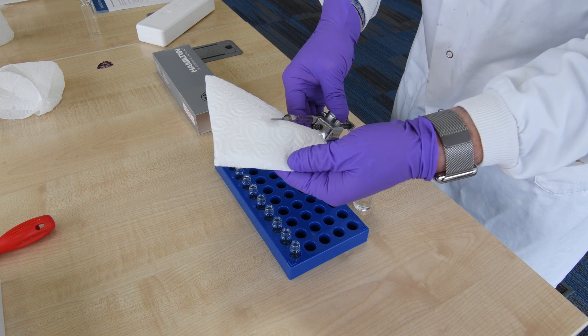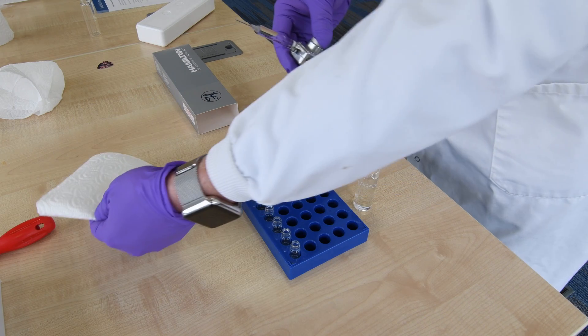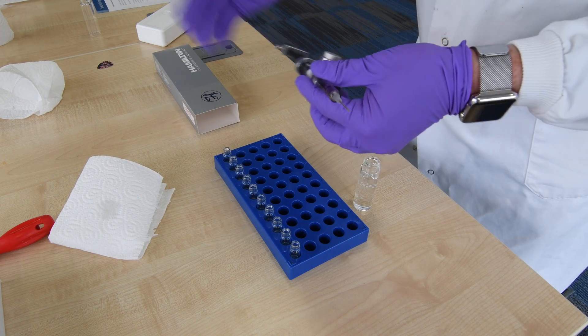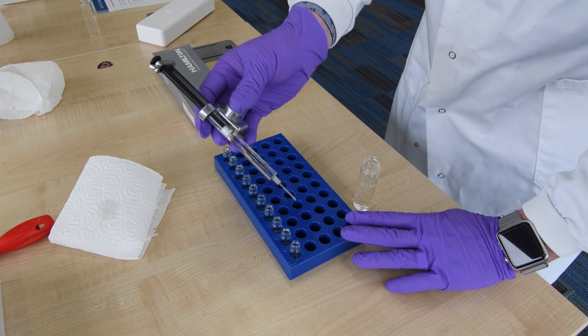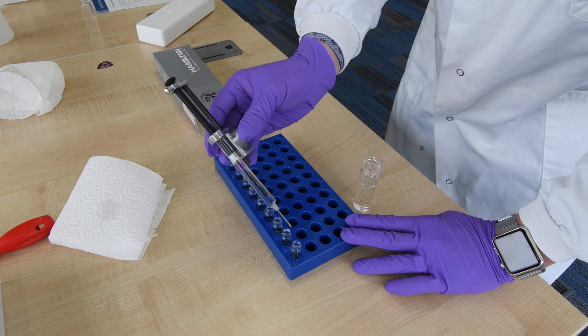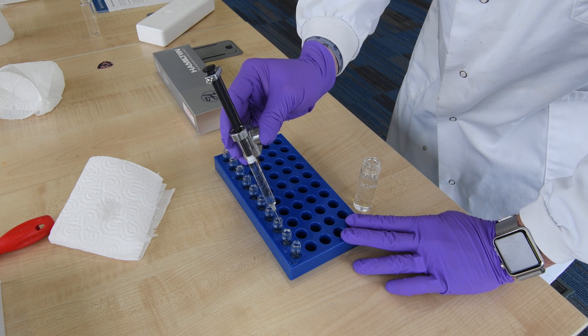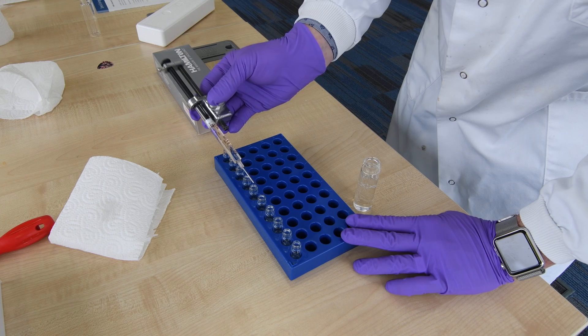A simple press at the top, we can dispel any air in the needle. Now with simple button presses, we're adding precisely our determined volume, which was 50 microliters.